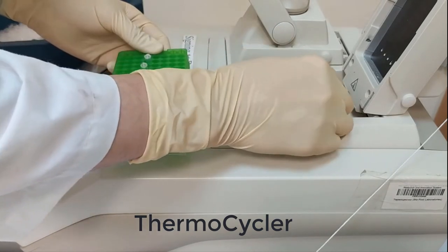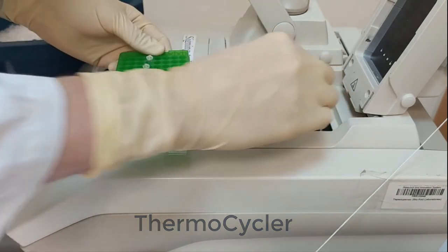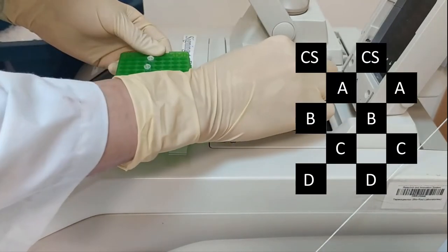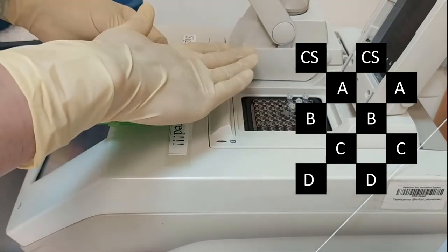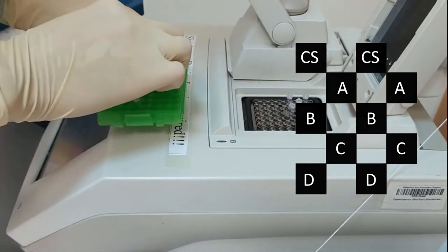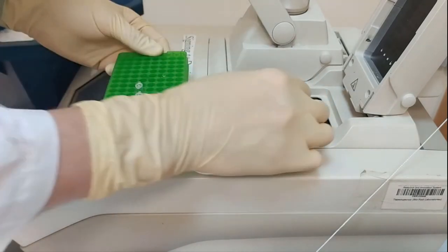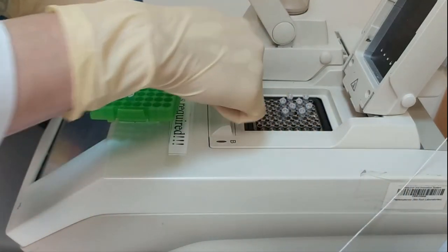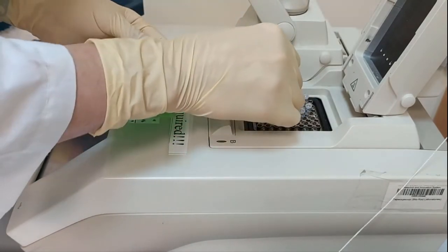So we are going to use all of these and put them like that so that we have the pressure dispersed on the tubes. Small recommendation is not to use the edges if you could because this way everywhere will be the same temperature.